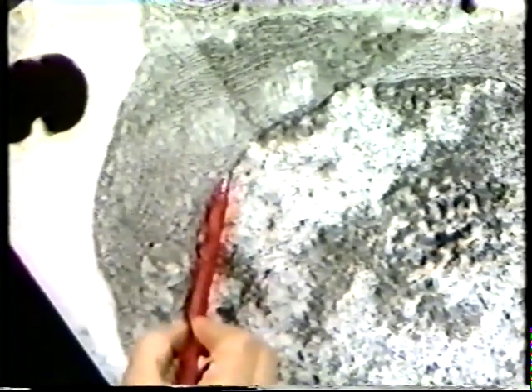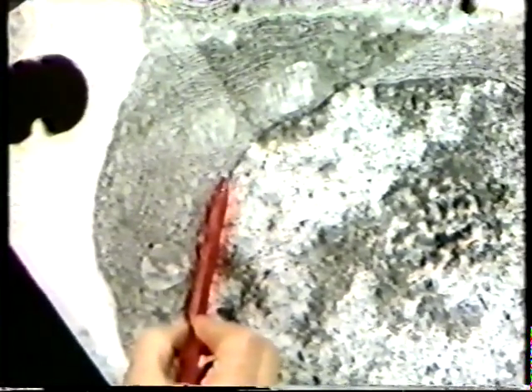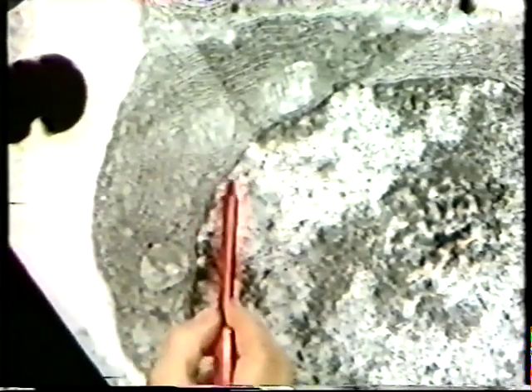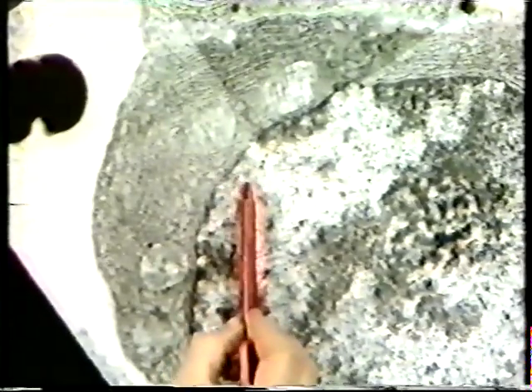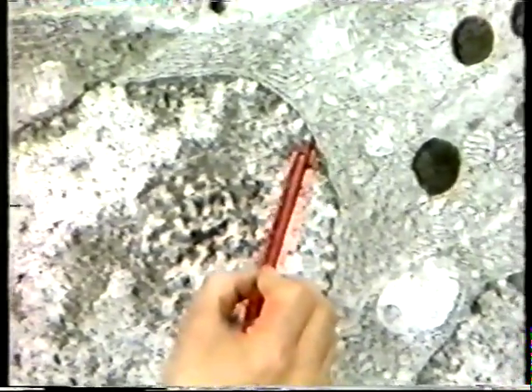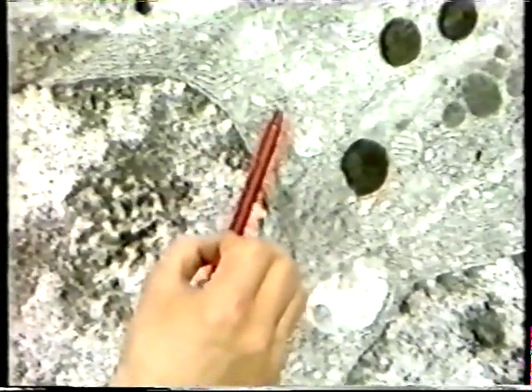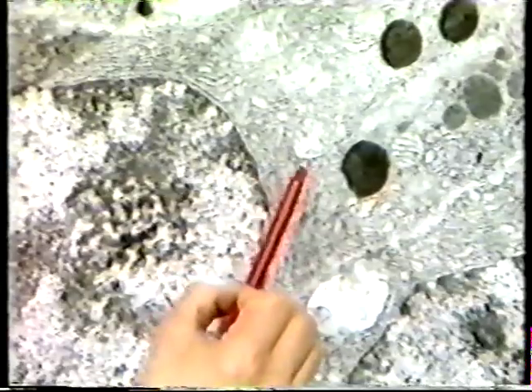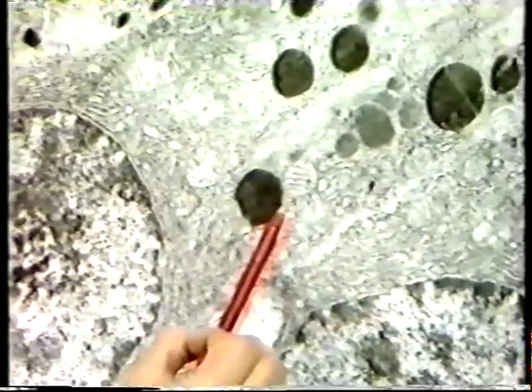We call it a nuclear envelope because it consists of two membranes. On the outer surface are a number of ribosomes, and on the inner surface is condensed chromatin. As we move up the nucleus, there is a large nucleolus. And when we move on up the cell, towards the top of the nuclear envelope, there is more rough endoplasmic reticulum, mitochondrion, and here, what could be a secretory granule.